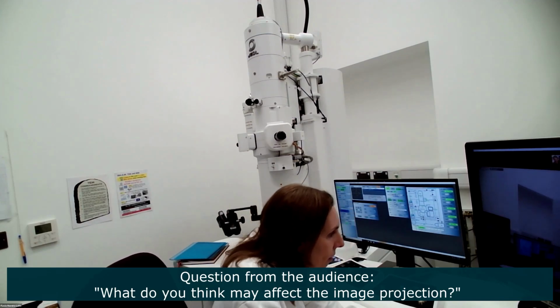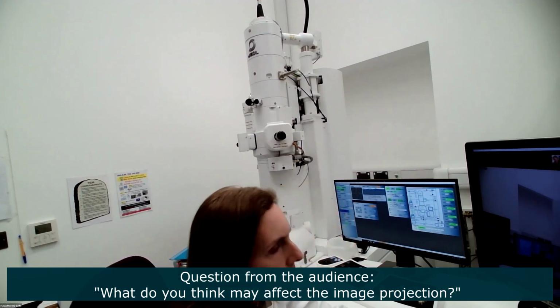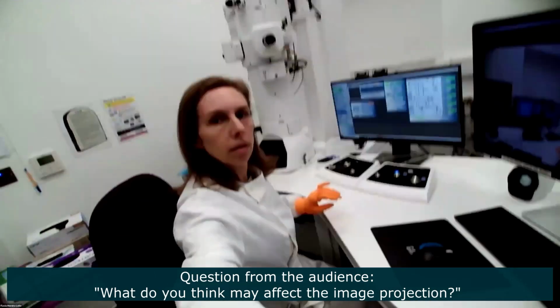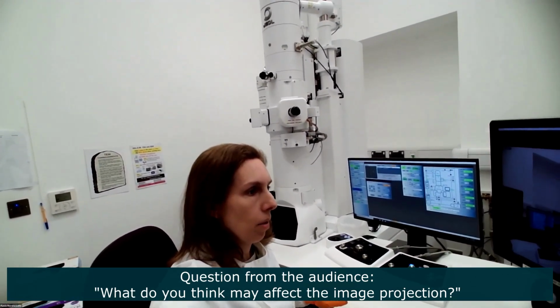what do you think may affect the image projection? So you mean what can affect the generation of an image? Is that what you mean?